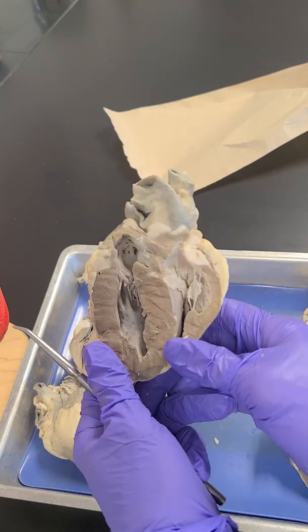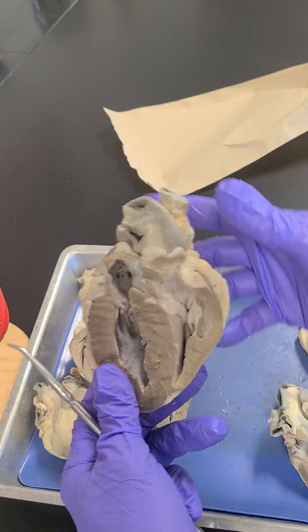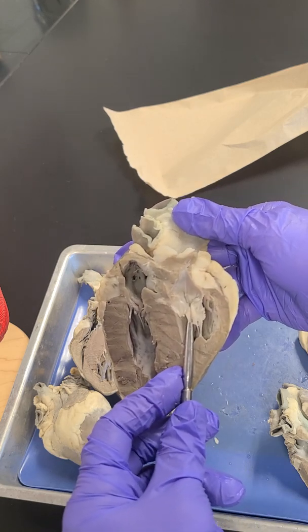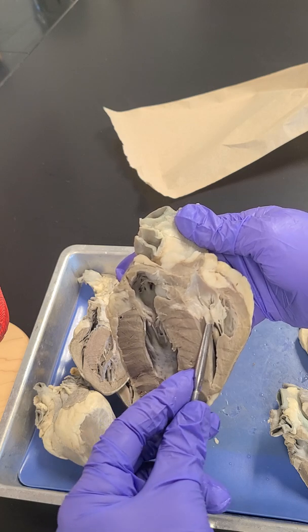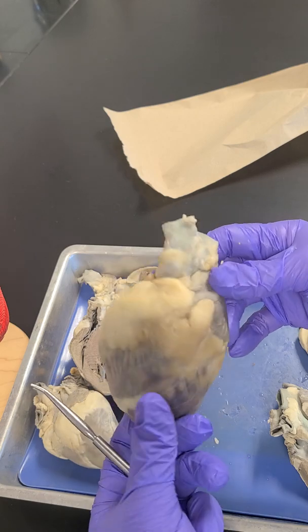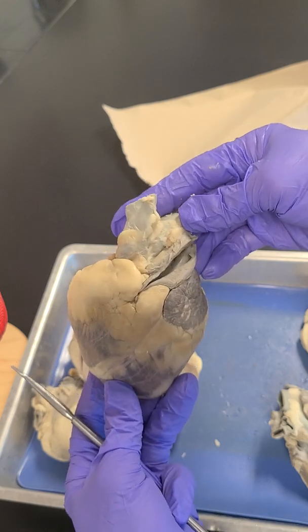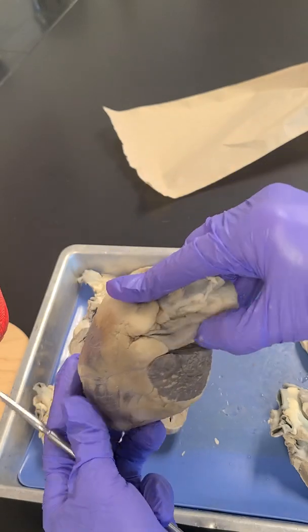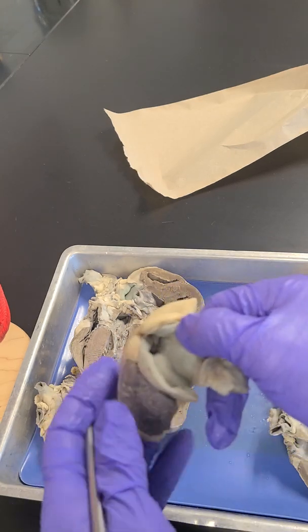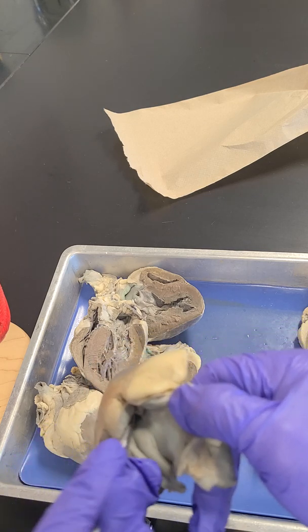So orient yourself to this heart. So figure out which chamber is what. Okay. So I want to know the name of this valve right here. What is the name of this valve? Okay. And then this is the anterior surface of the heart, and I'm opening up this vessel, and there's a valve in here. Hopefully this valve that you can see right here. What is the name of this valve?